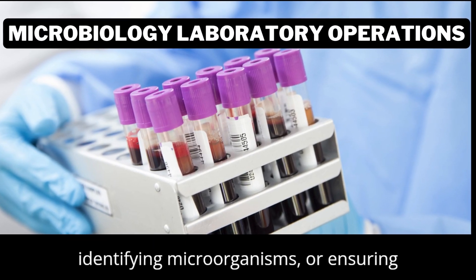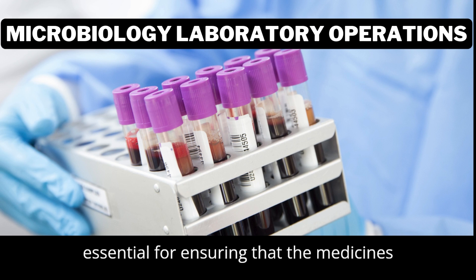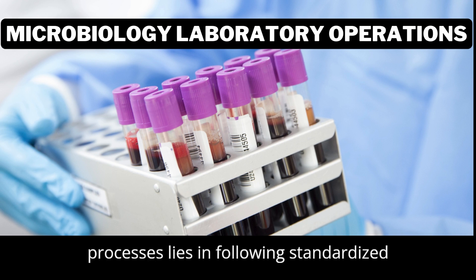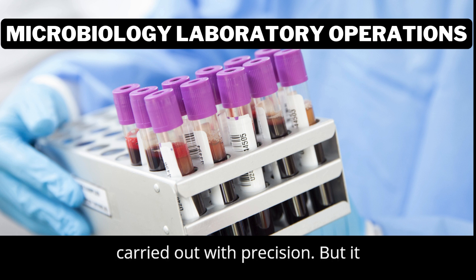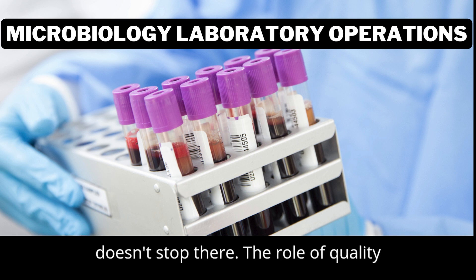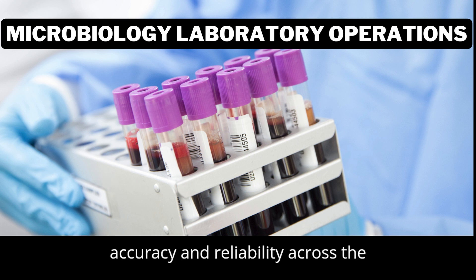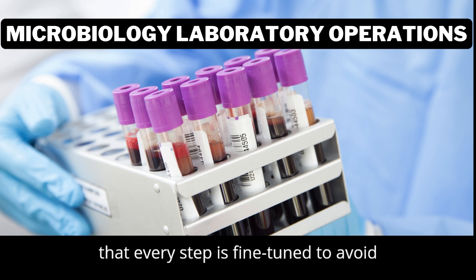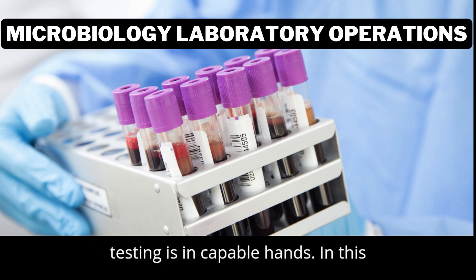Whether it's sterility testing, identifying microorganisms, or ensuring endotoxin levels are within safe limits, the work done in these laboratories is essential for ensuring that the medicines we rely on are free from harmful contaminants. The foundation of these processes lies in following standardized methods and ensuring that every test is carried out with precision. But it doesn't stop there. The role of quality assurance and consistent equipment maintenance is crucial for upholding accuracy and reliability across the board. Validation of test methods ensures that every step is fine-tuned to avoid any errors, and the proper training of laboratory personnel guarantees that testing is in capable hands.